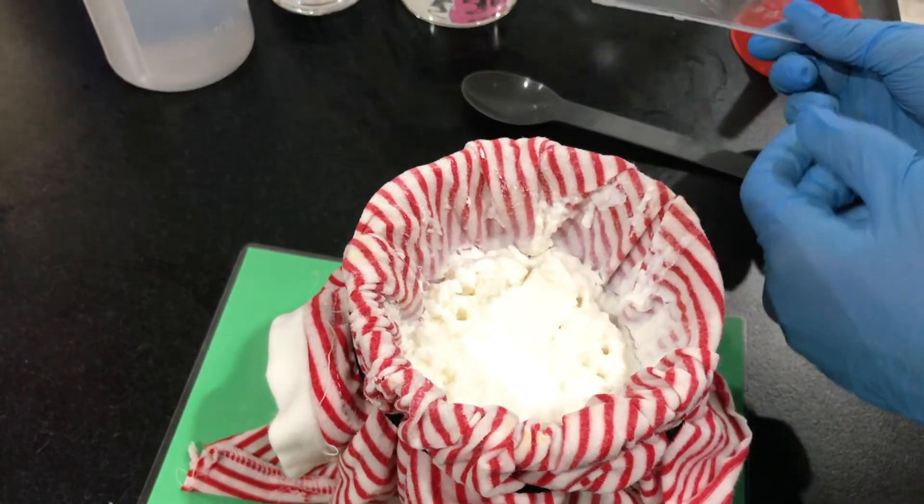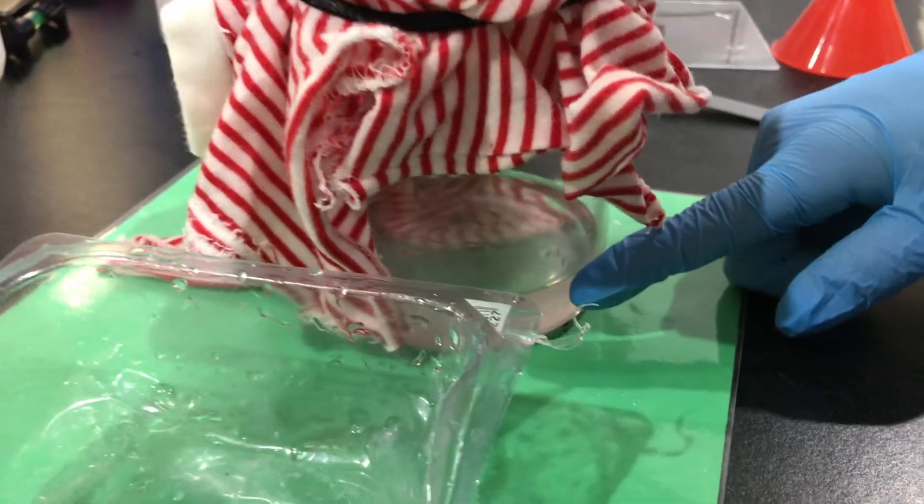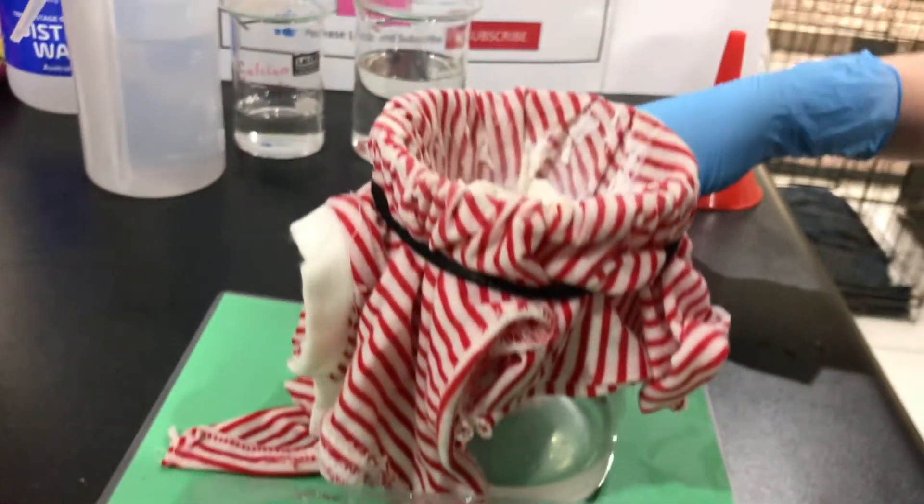After leaving the calcium hydroxide overnight in the cloth filter, I am now going to remove it and dry it. Overnight some more sodium acetate separated.